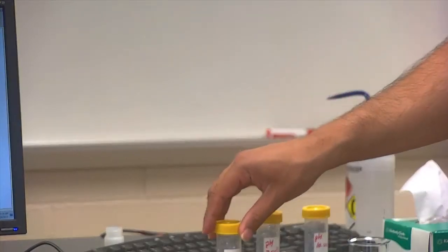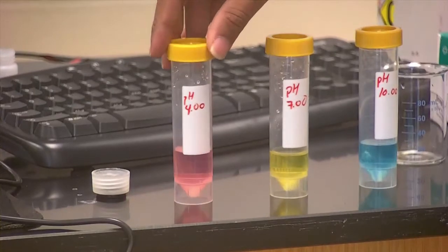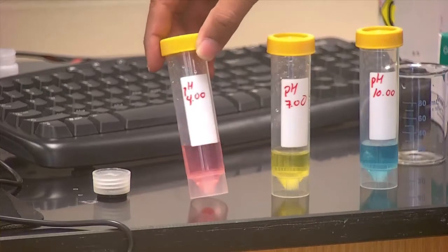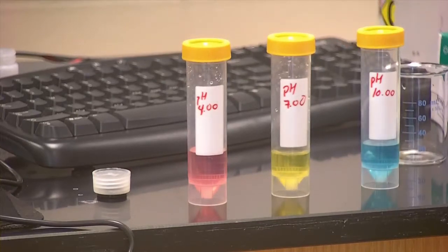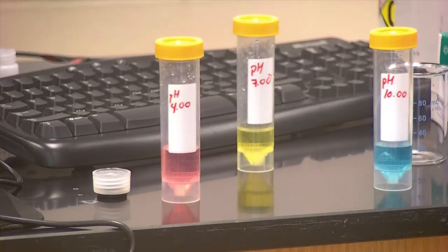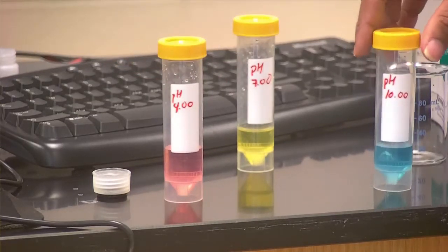What I have here are a series of calibration buffers. This is known to be a pH 4 solution. This is known to be a pH 7 solution. And this is known to be a pH 10 solution. What I'd like to do is calibrate the pH meter to realize this is what a pH 4 measurement looks like, this is what a pH 7 measurement looks like, and this is what a pH 10 measurement looks like, before I put in my actual sample. Usually I do a 2-point buffer calibration, one at pH 4 and one at pH 10, so that it's priming the pH meter that whatever sample I put in is going to be relative to something that it knows is pH 4 or pH 10.